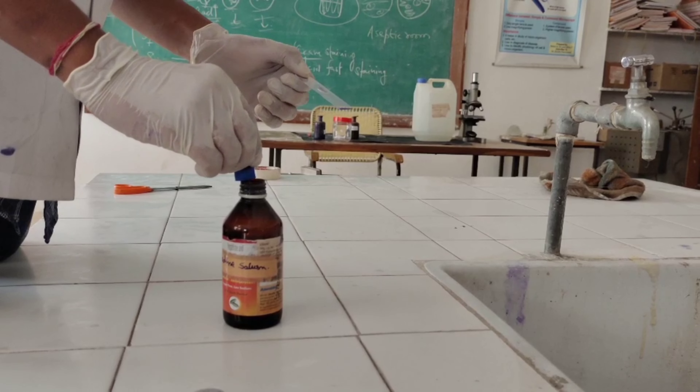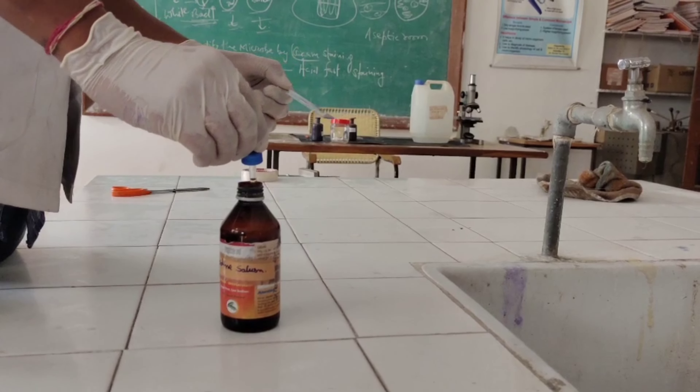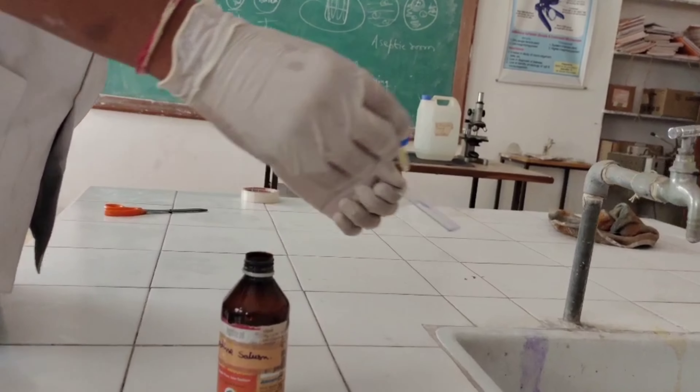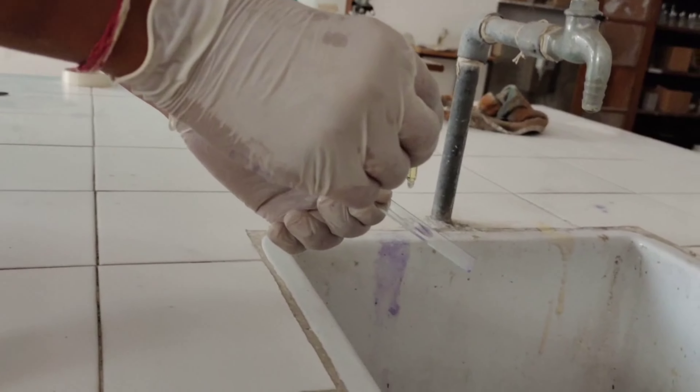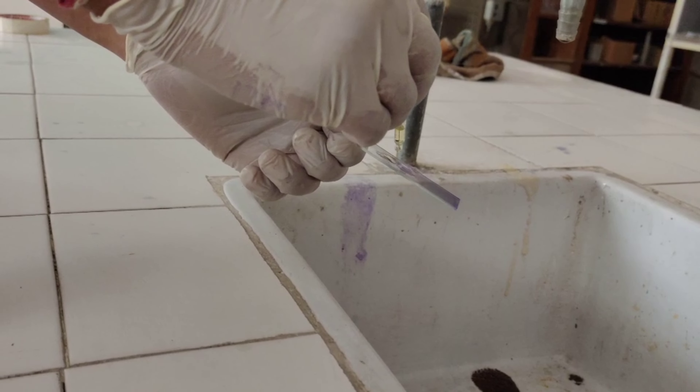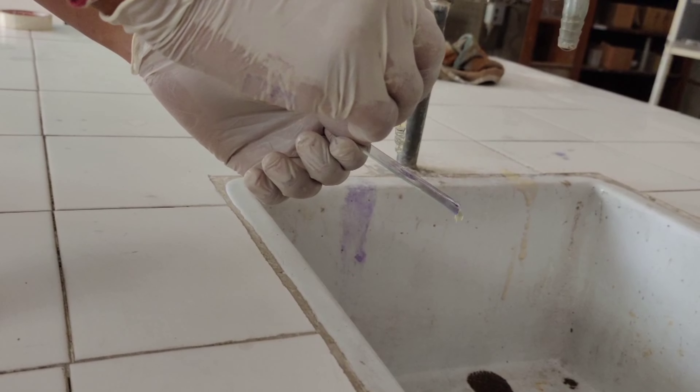After washing the smear with water, iodine mordant is added to the smear, followed by rinsing with water after 60 seconds.